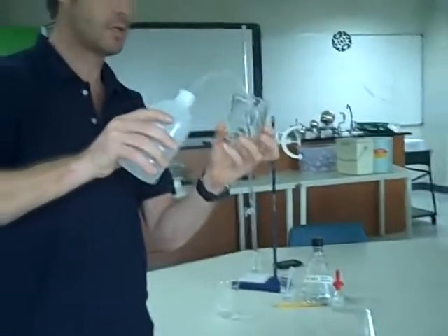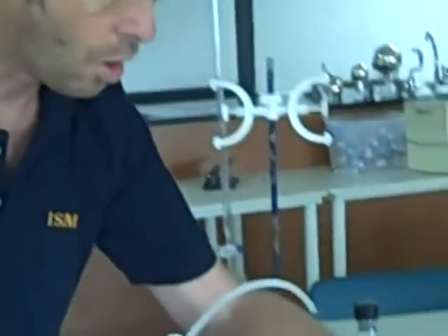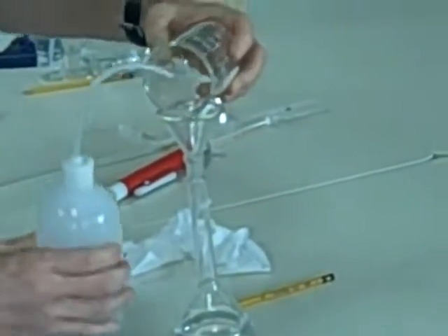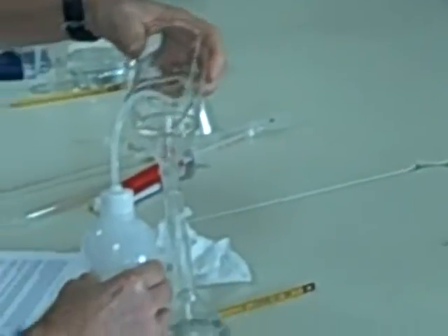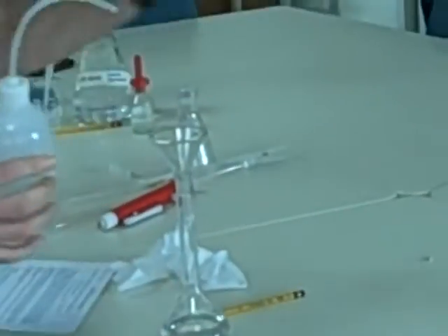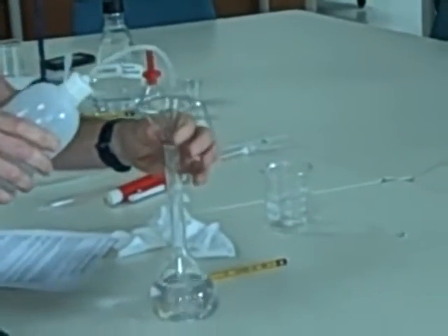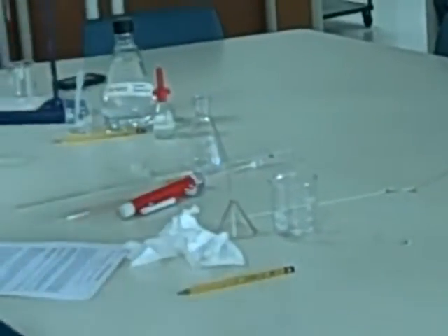So we have to wash our solution into here. Okay, we've got everything out of there. Just rinse that a little bit. Okay, and now we're going to make up.